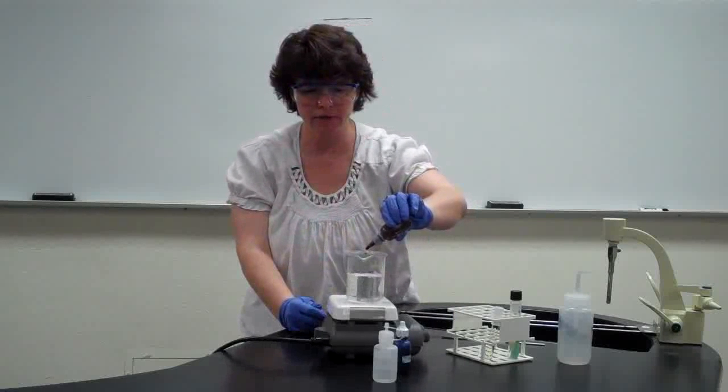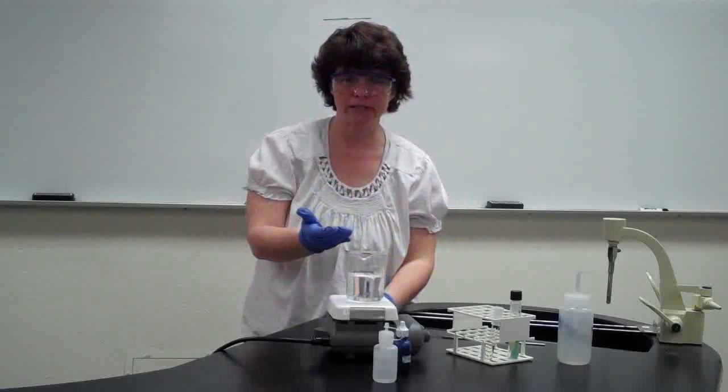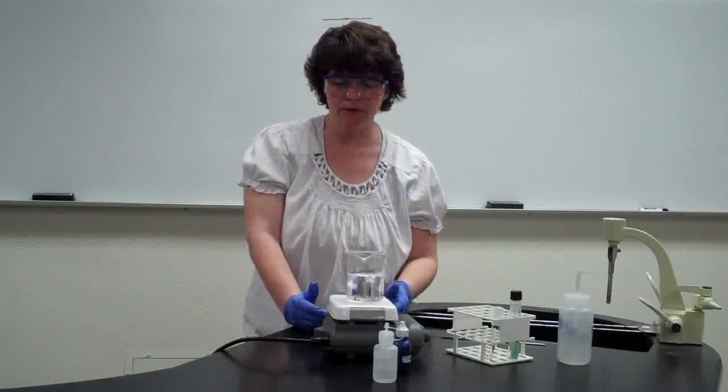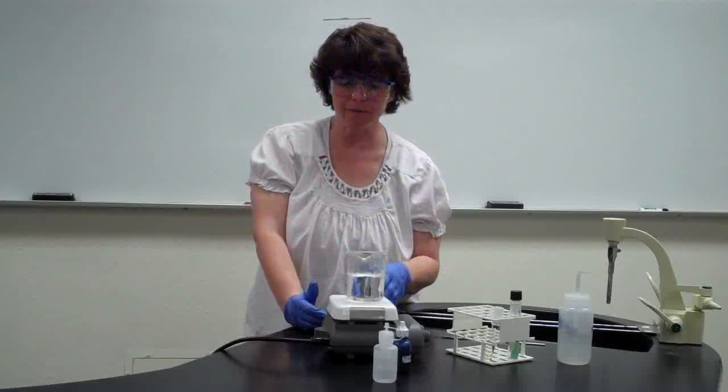So you're just going to put it on there. What you want to make sure doesn't happen is that it dries out. So you're going to put it on there, and it says to let it sit for 5 minutes, and you are going to let it sit for 5 minutes.